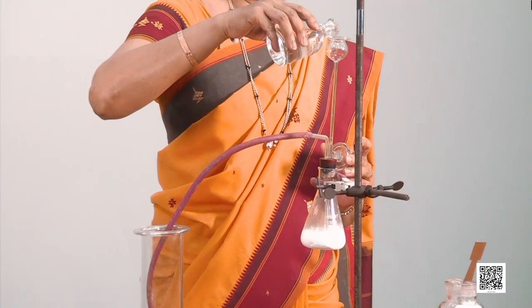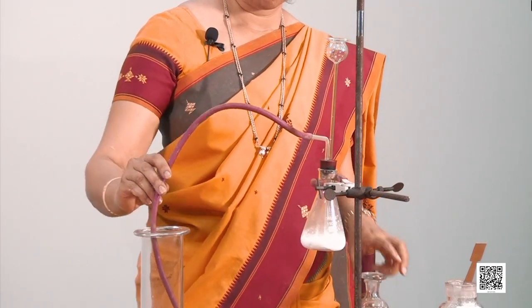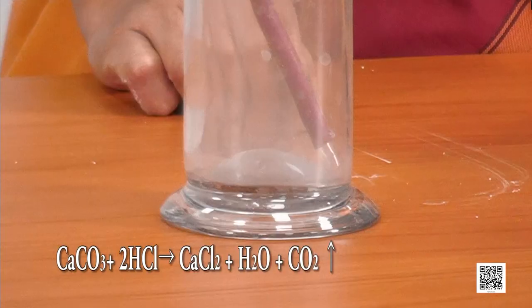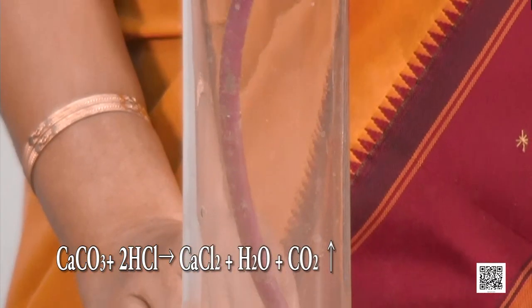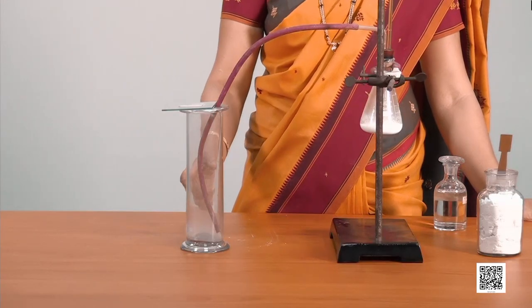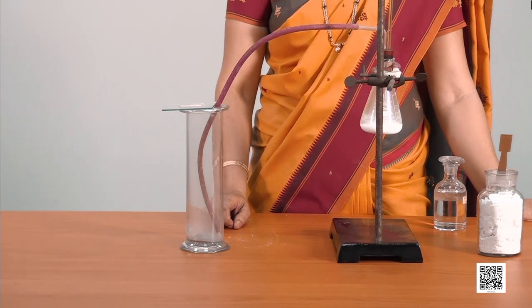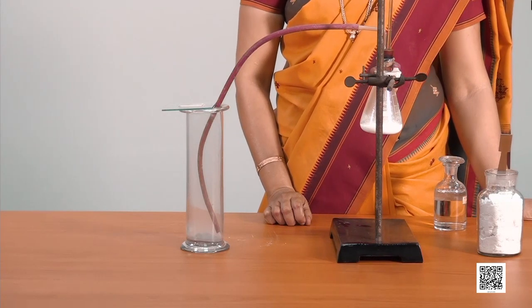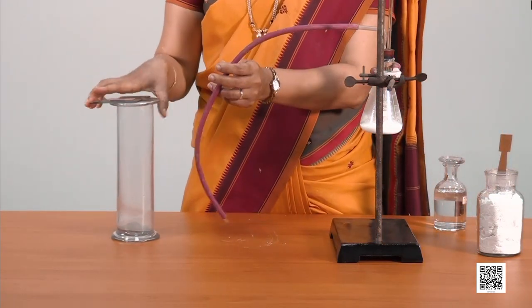Add about 5 ml of dilute hydrochloric acid and collect the gas by the upward displacement of air. Observe the colour of the gas — it is colourless. Carbon dioxide is collected by the upward displacement of air because carbon dioxide is heavier than air, so it will not mix with the air, and we can collect it this way.